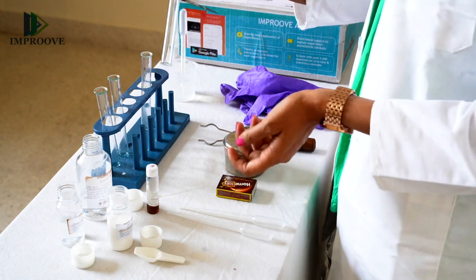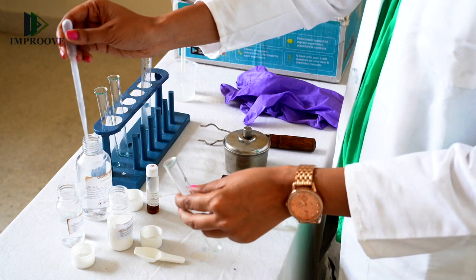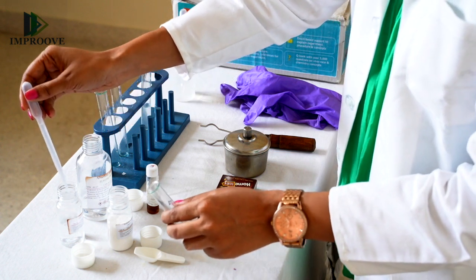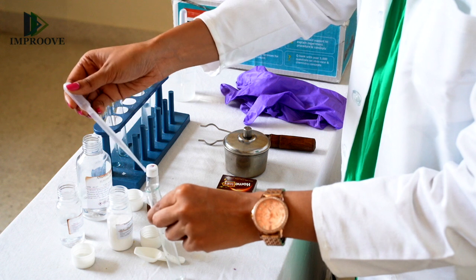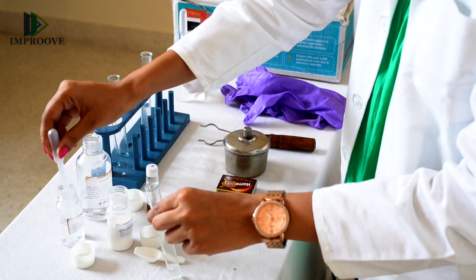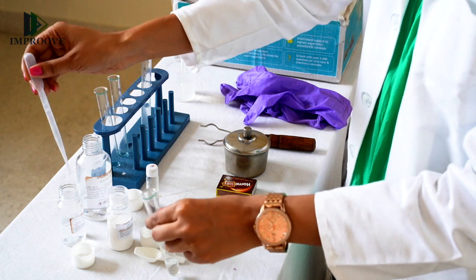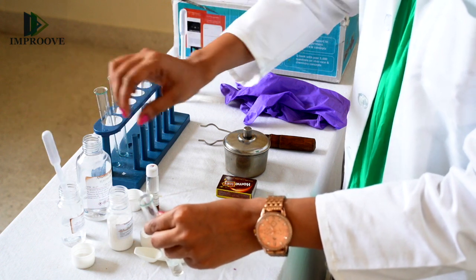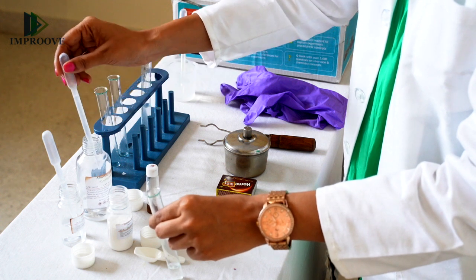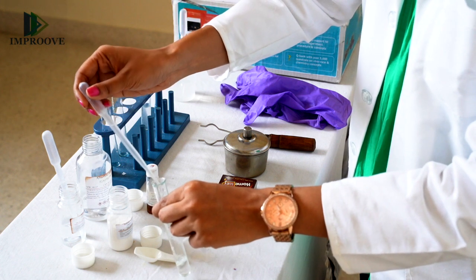In another clean and dry test tube, take a fresh dropper and add about 3 ml of your ethanoic acid. To this, add again 3 ml of your absolute alcohol, that is ethanol.